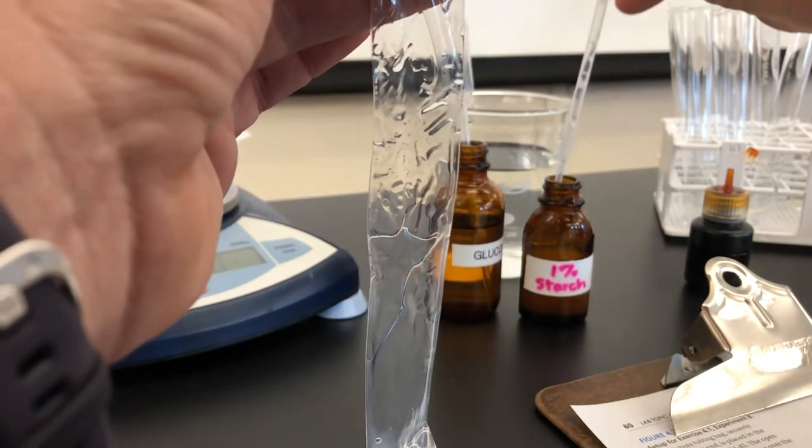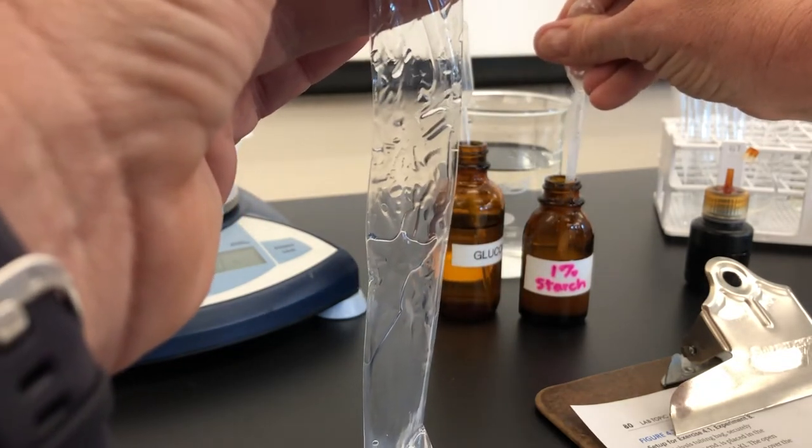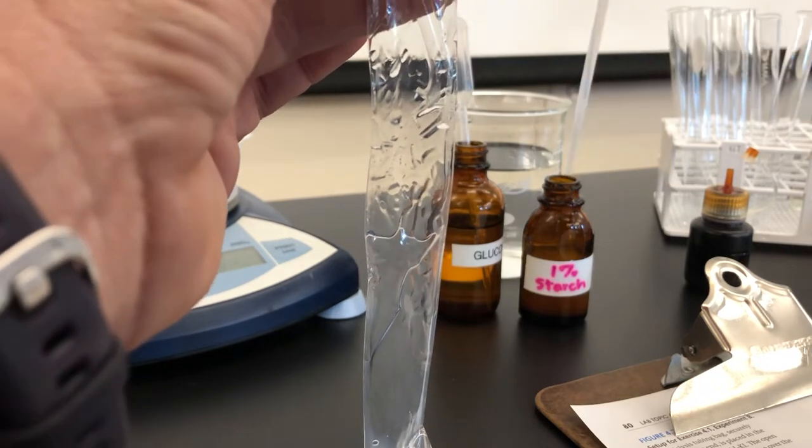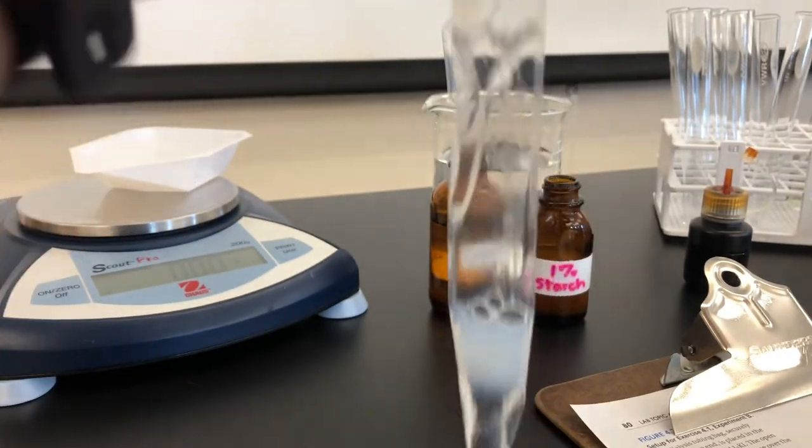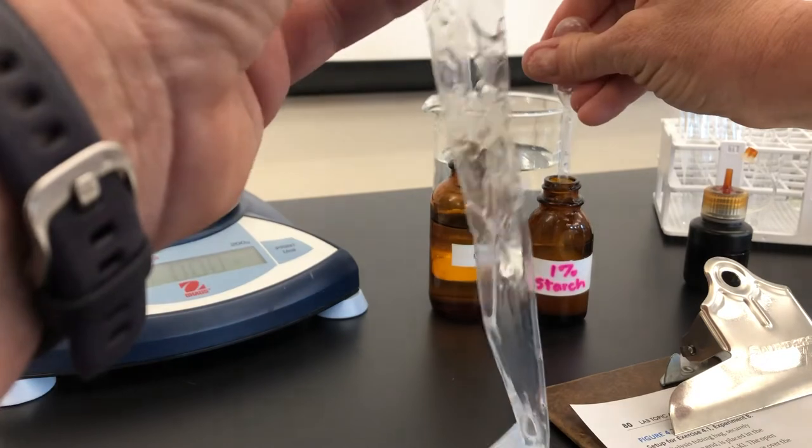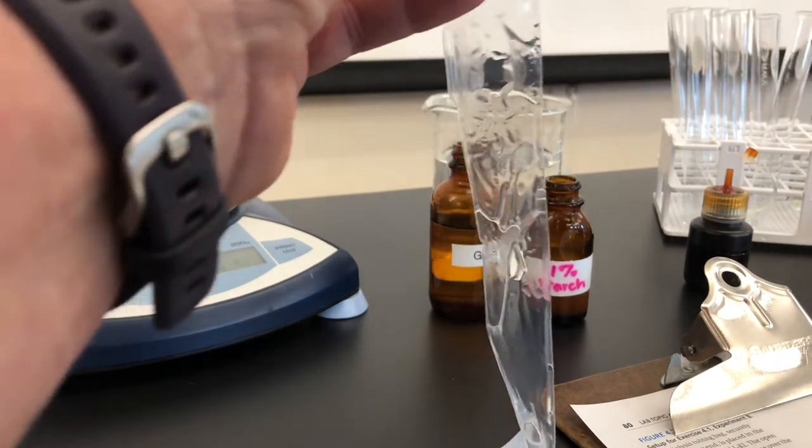And if you recall from lab two that in order to test for the presence of these we use different reagents. For starch, we can simply use Lugol's iodine.